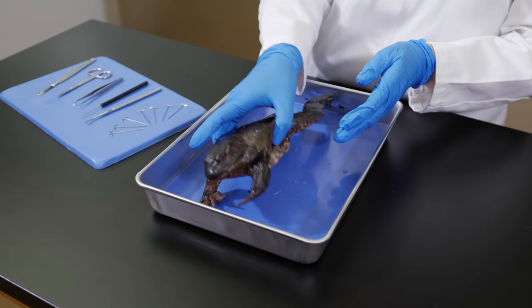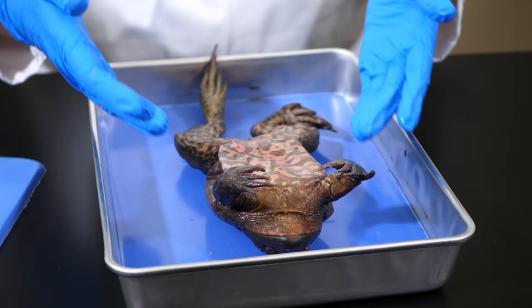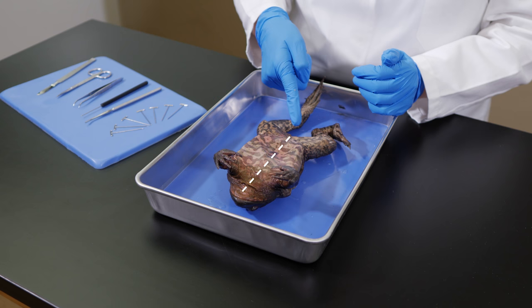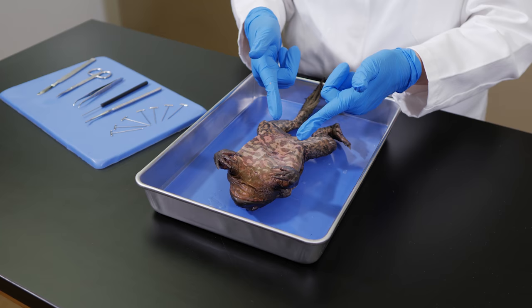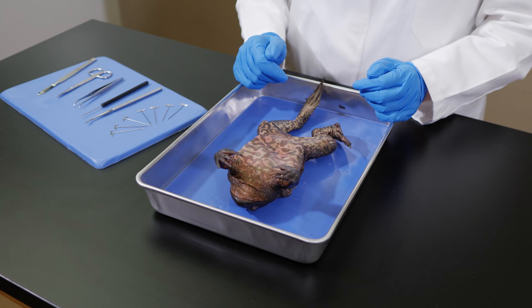The underside, or lower portion, is called the ventral surface. We are seeing a ventral view of the specimen. The sides of the specimen are called lateral surfaces. An imaginary line drawn from the anterior region to the posterior region through the middle of the specimen is called the axis. Features that lie near the axis are medial features, and features that lie away from the axis are lateral features.